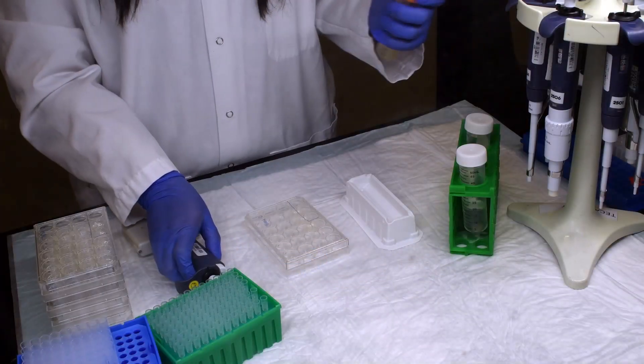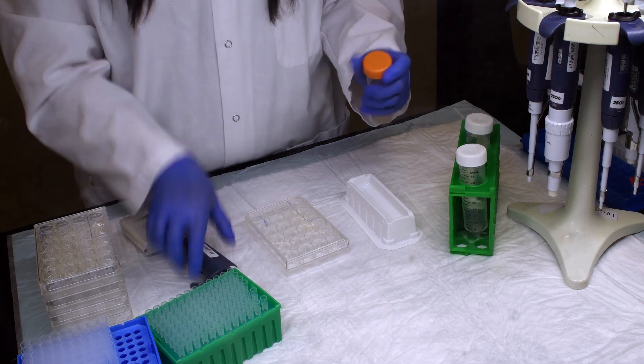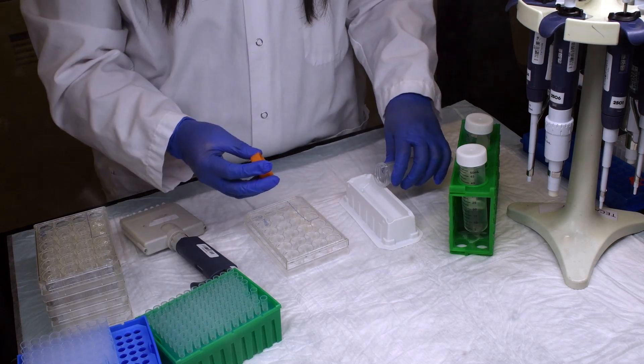In this demonstration, we will start with the hepatocytes already thawed and diluted to a density of 2.5 million cells per mil in incubation medium.